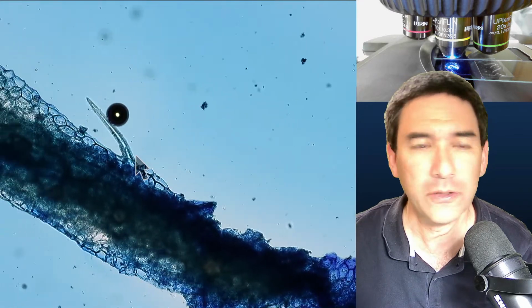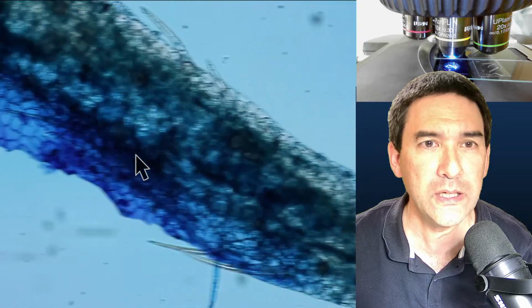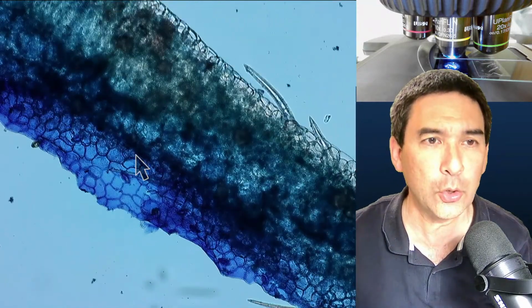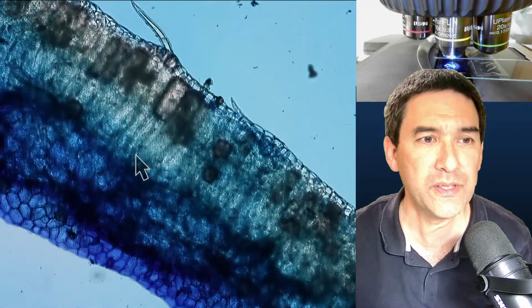So why does alcohol shrivel up? Because alcohol will actually remove the water. The water will mix with the alcohol, and then the alcohol will evaporate, so there is essentially nothing left.